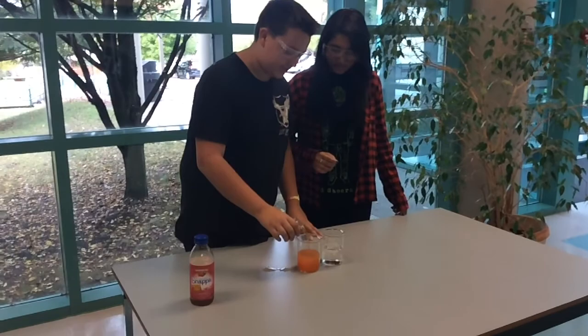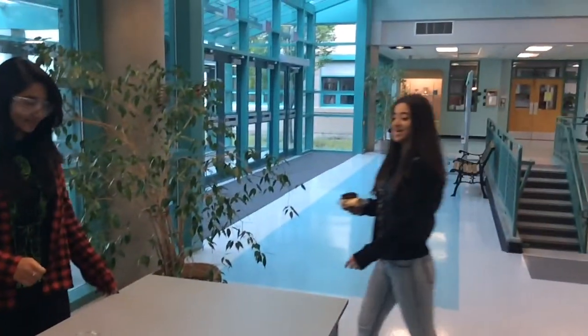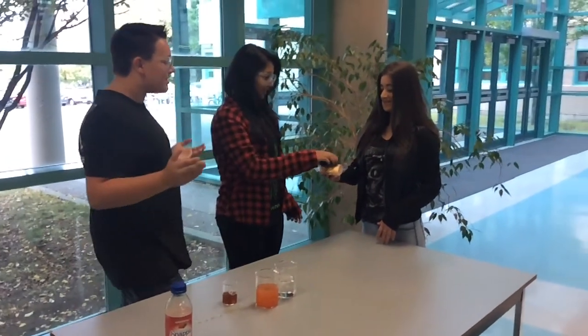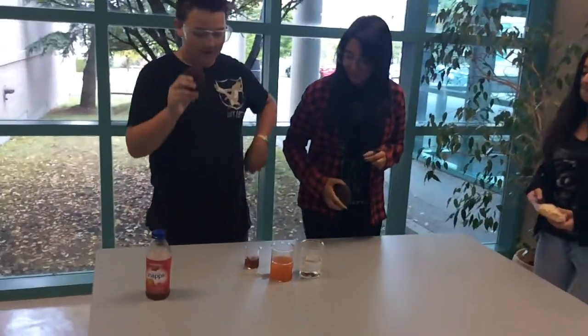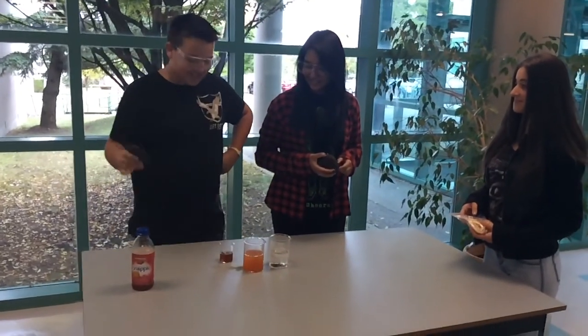Really go for some baked goods right now. I'm so hungry. Hey guys, look what I made. Want to try some? Wow, sure. I was just asking for those. Oh, thank you. You know what made this even better? Snapple of folic acid.